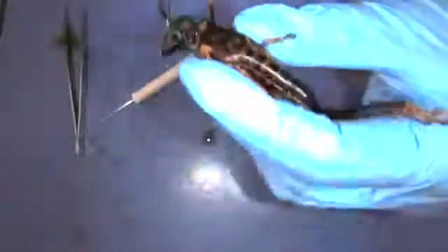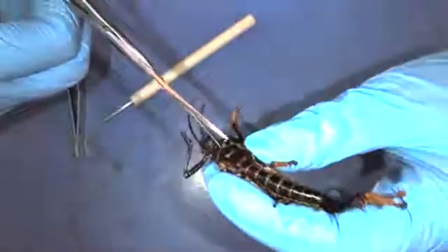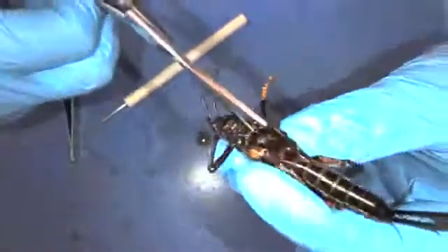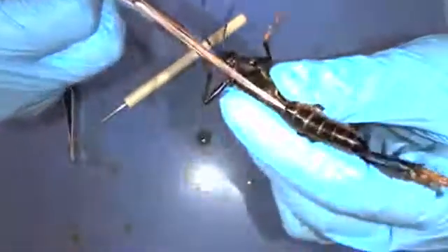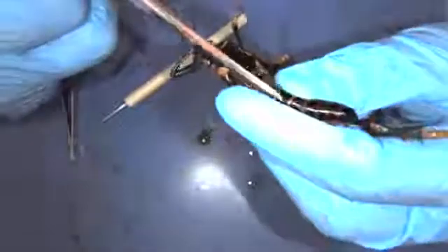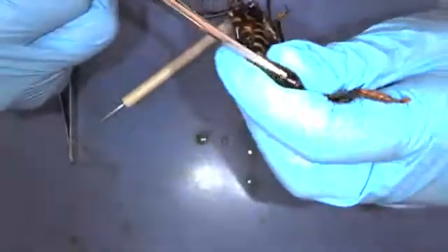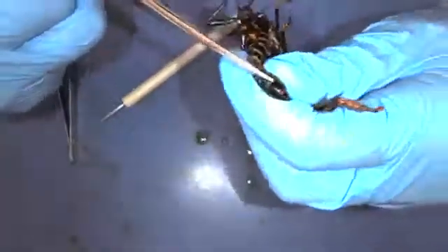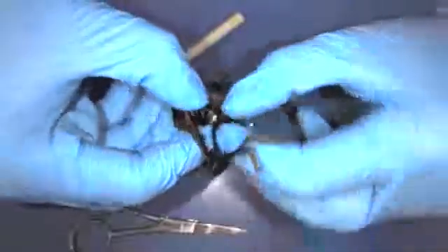So now we're going to cut through the exoskeleton down the abdomen. I'm going to start up here and gently cut through our grasshopper to look at some of the internal anatomy. They're pretty simple inside, but they do have some cool features that are only found in insects.